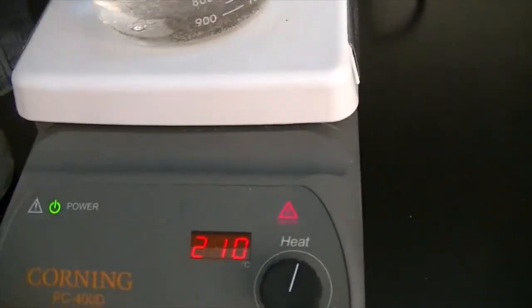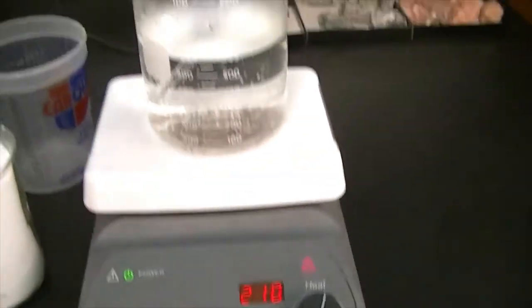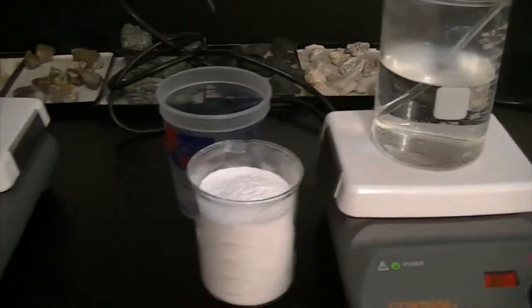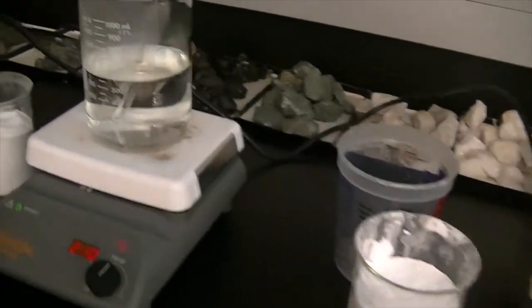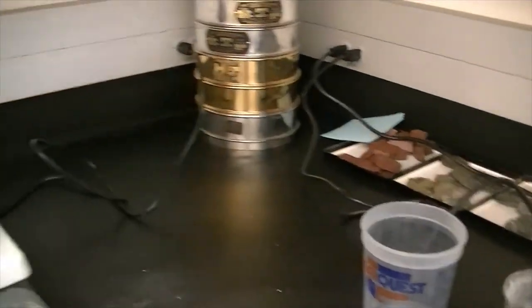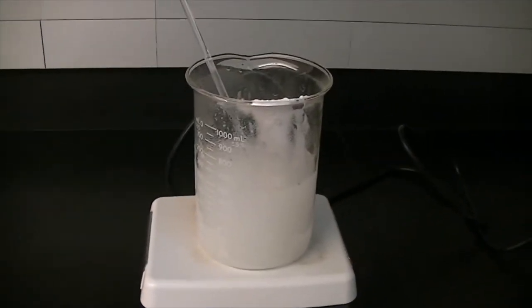All temperatures are set the same at 210 degrees. I'm going to add the ammonium phosphate solutions to all five beakers, stir for a while — it'll take me at least half an hour to an hour — then come back, let these cool a little bit, add some food coloring, pour them into containers, and discuss what I did and what the concentrations were.